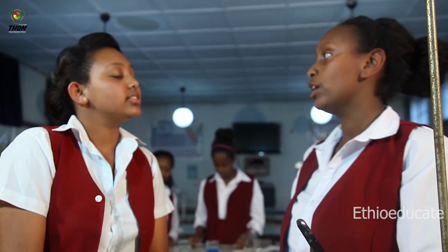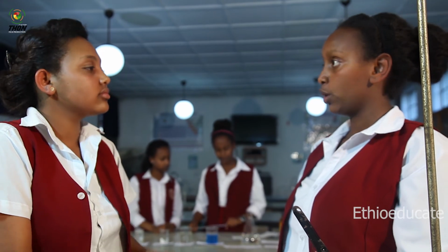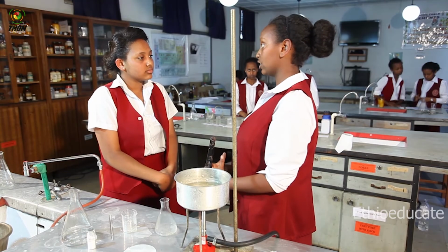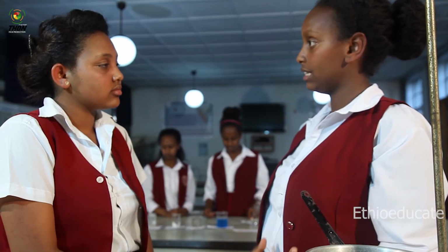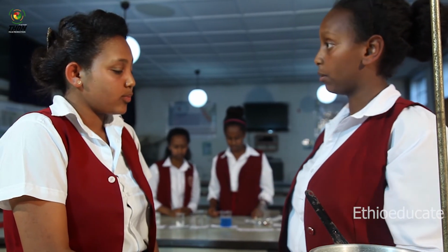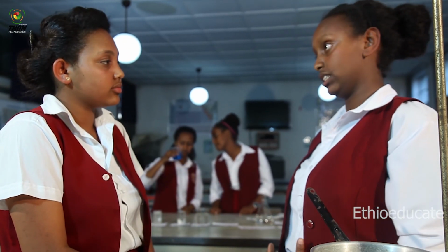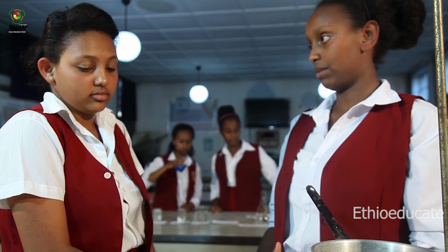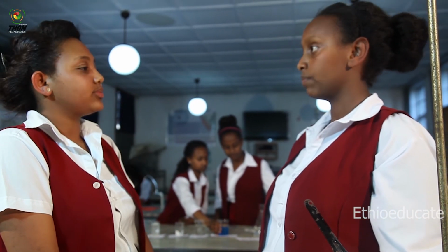Yes, that's very correct. Yes, so let's generalize the experiments we performed today, shall we? First, we saw the physical and chemical properties of matter. We defined property as a set of characteristics. Then we showed some ways of separating a mixture. The first was a physical method of separating liquid mixtures, which was simple distillation. Then we saw another method of purifying solid compounds, which was recrystallization.